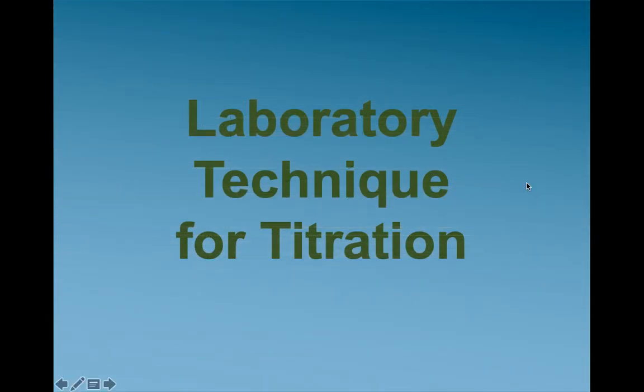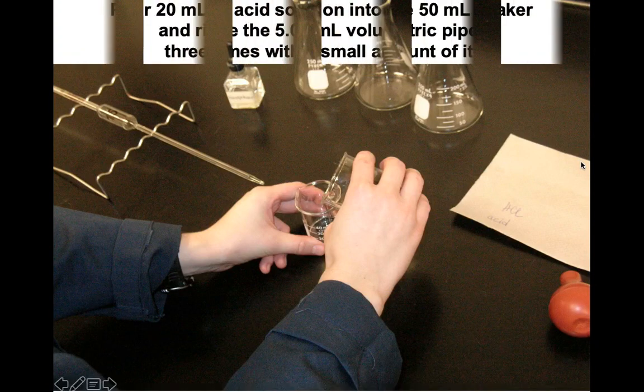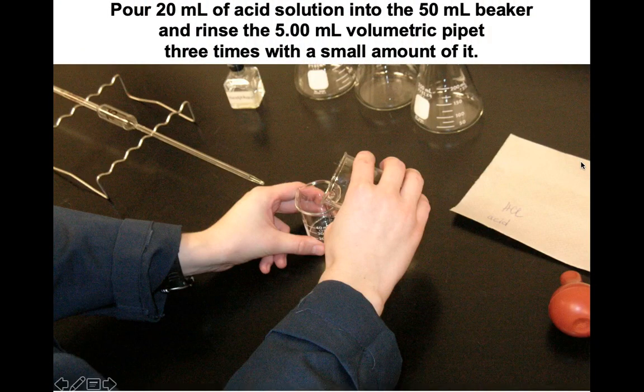Let's take a look at the lab technique for titration. We would pour the acidic solution into a 50 milliliter beaker, assuming that it's clean. It's washed out with soapy water, and then the last rinse is distilled water, and then we would dry it out to make sure that the concentration of the acid is the correct concentration that we want.